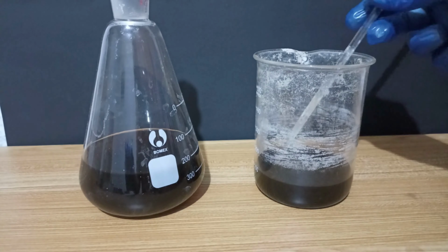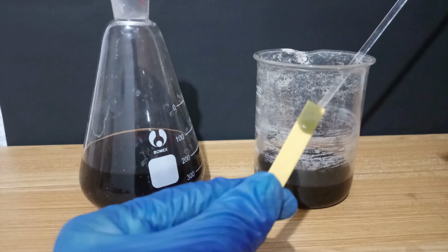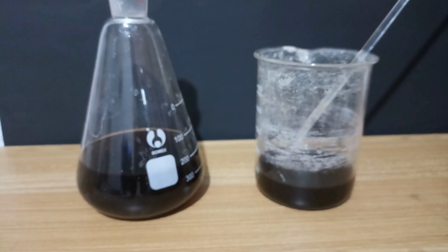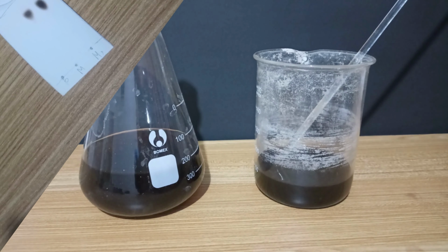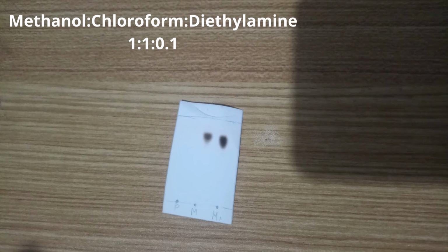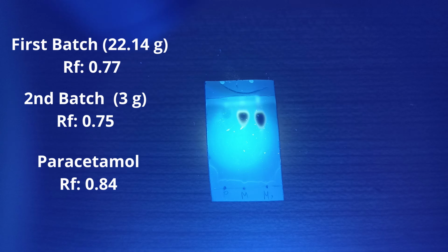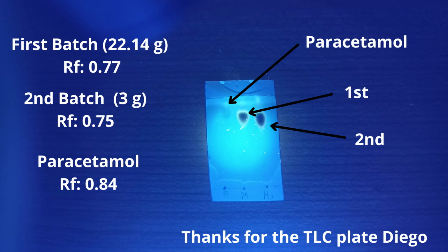As a fun fact, the solutions containing p-aminophenol got dark in no time. This is because p-aminophenol is very unstable in alkaline and neutral solutions. To finish the experiment, I made a TLC of the two solids and paracetamol. As you can see, the two solids have the same retention time, and paracetamol is a little bit higher than that.